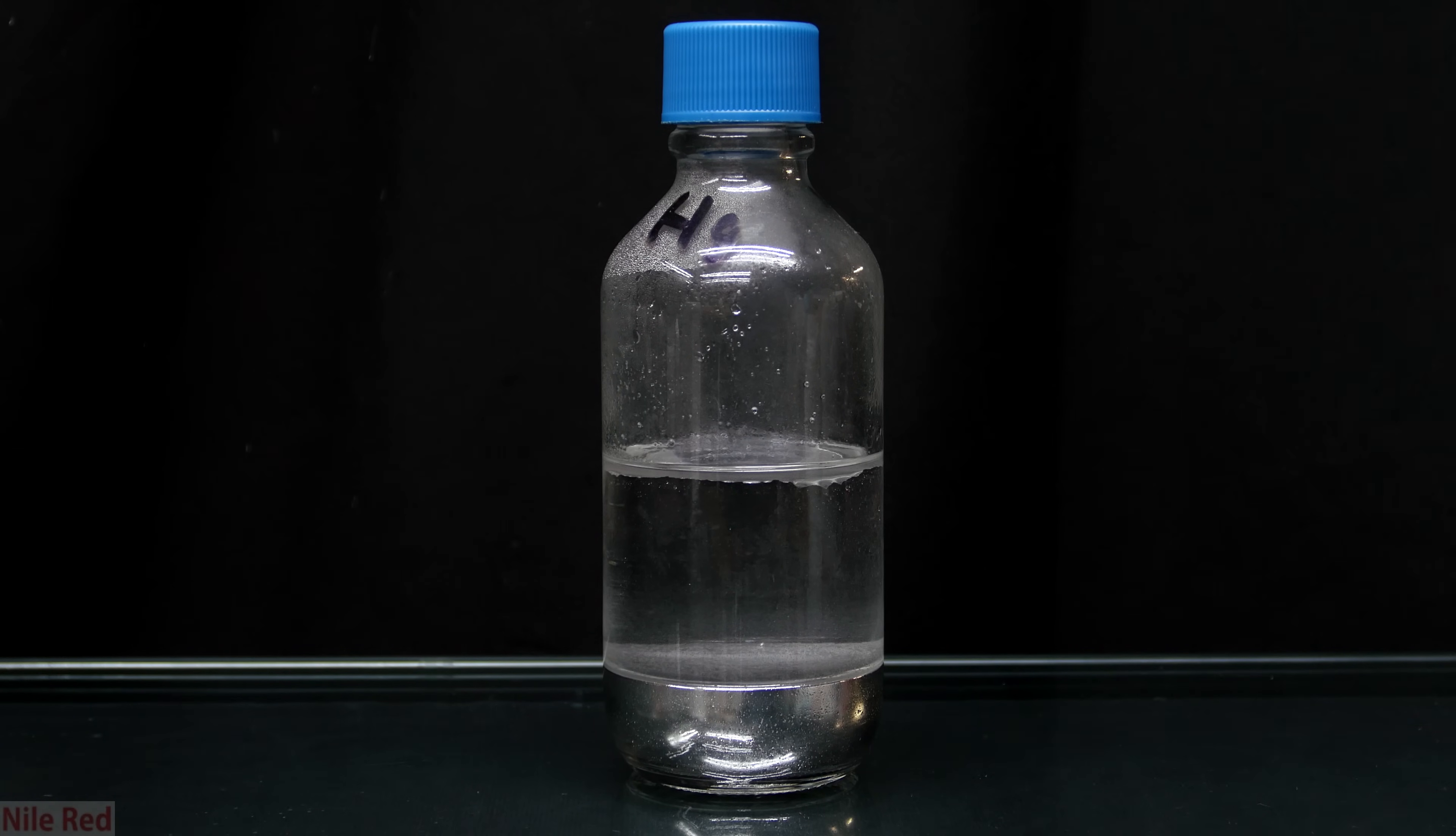So my two goals in this cleanup will be removing the oil that the mercury is contaminated with and I also want to filter out any of the solid impurities. A lot of this mercury is from old broken thermometers and for this reason there's a bunch of broken glass mixed in.